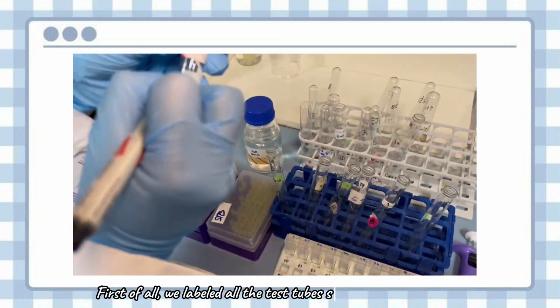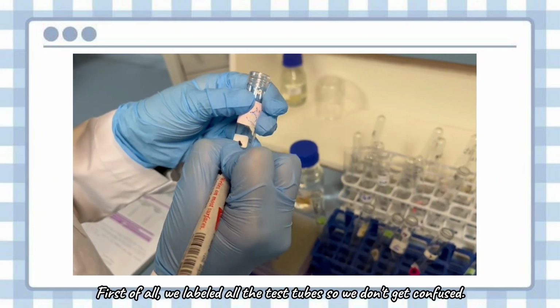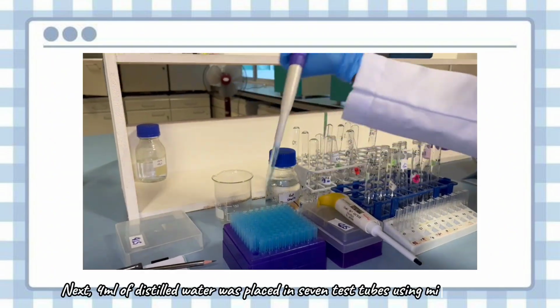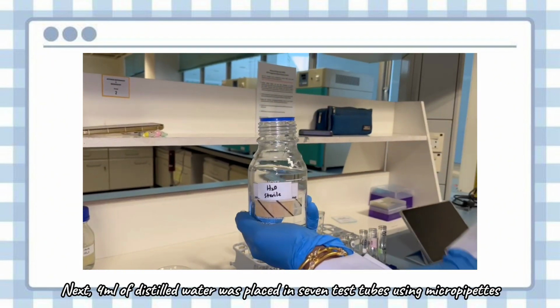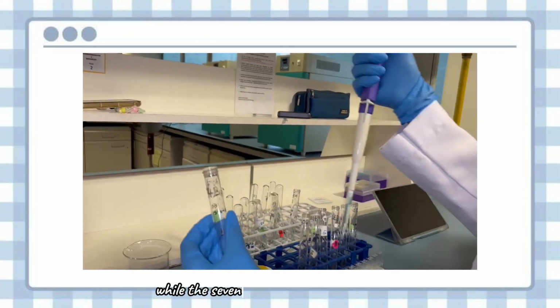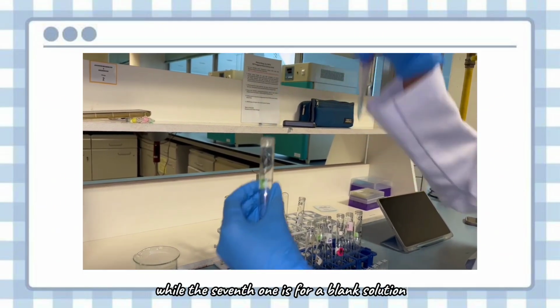First of all, we label all the test tubes so we don't get confused. Next, 4 ml of distilled water was placed in 7 test tubes using a micropipette, while the 7th one is for a blank solution.